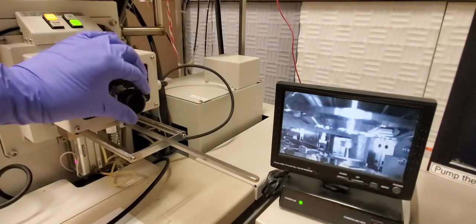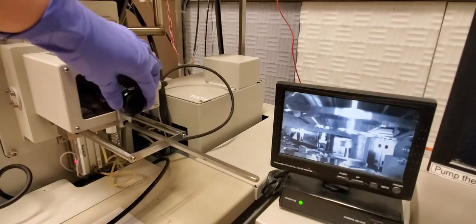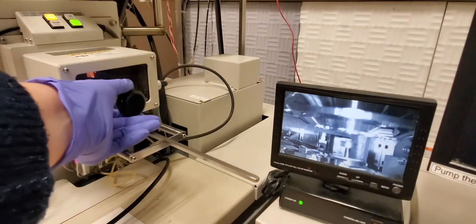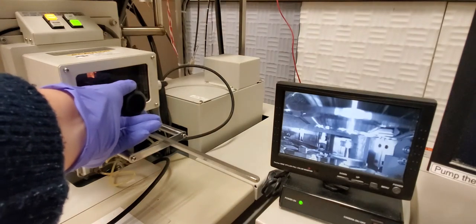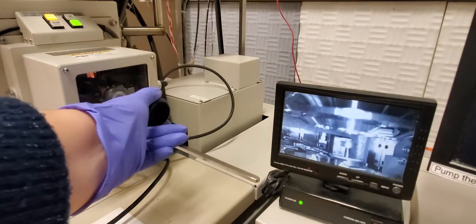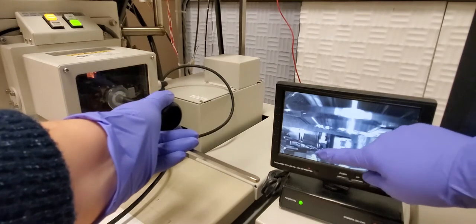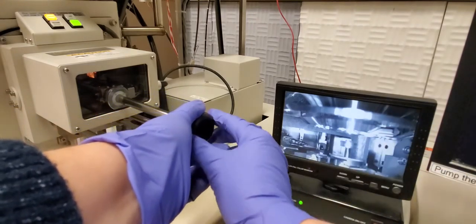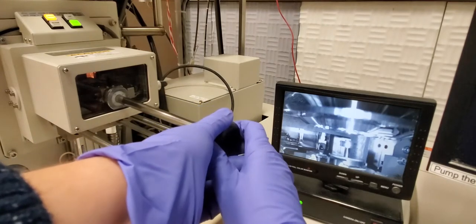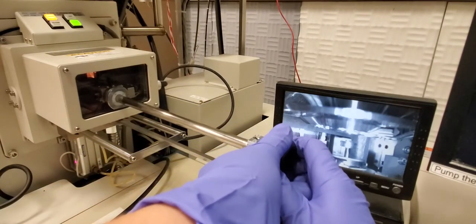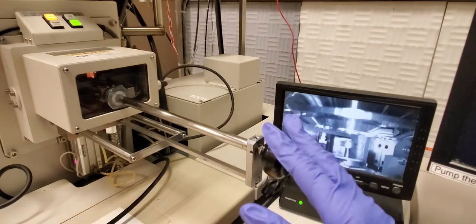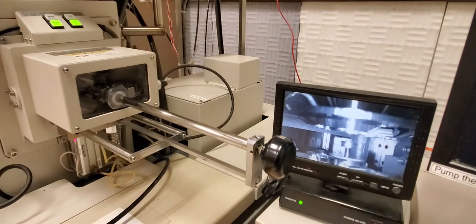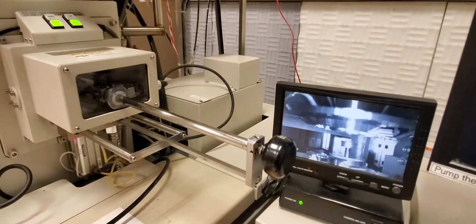So now we're going to unlock the rod so that it will leave the sample inside and gently pull the rod straight back out. Make sure when you get to the end here, you pull the rod just a little bit more so that it will stay by itself. And now it's safe to close the door. Do not close the door if the rod is not pulled all the way out.